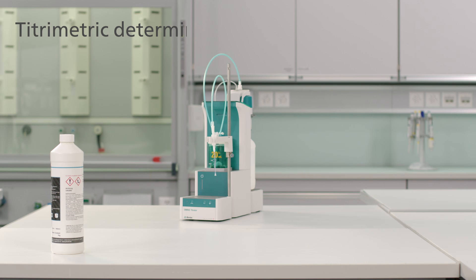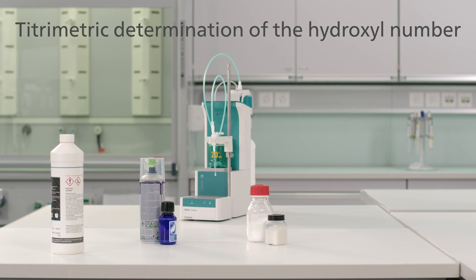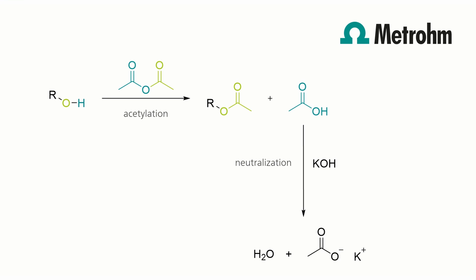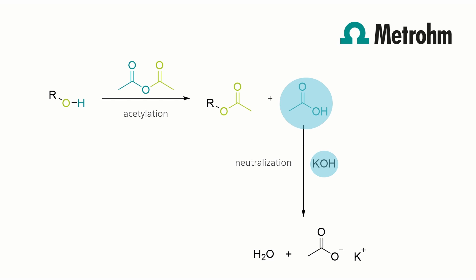The hydroxyl number, or hydroxyl value, is a key quality parameter for resins, paints, polyols, fats and oils. The hydroxyl number is related to the amount of free hydroxyl groups in a sample. This information is needed for the quality control of finished products or further processing of raw materials. The hydroxyl number is defined as the number of milligrams of potassium hydroxide required to neutralize the acetic acid released from the acetylation of one gram of sample.